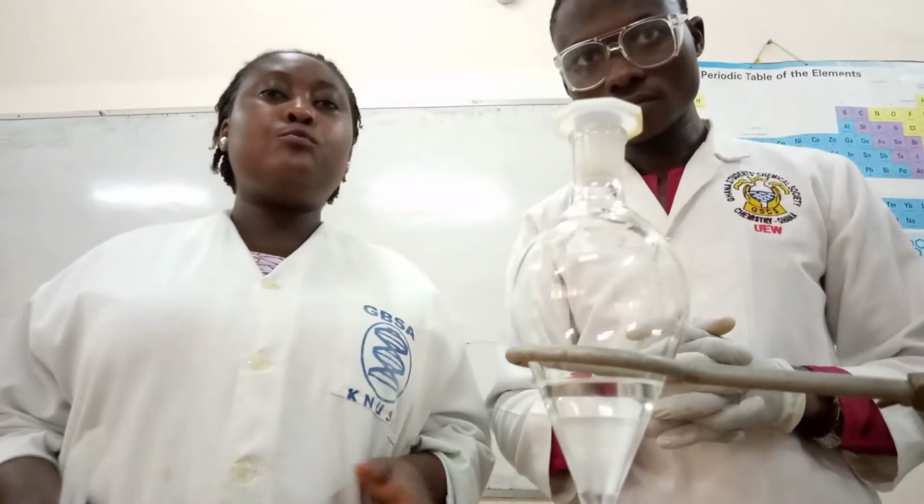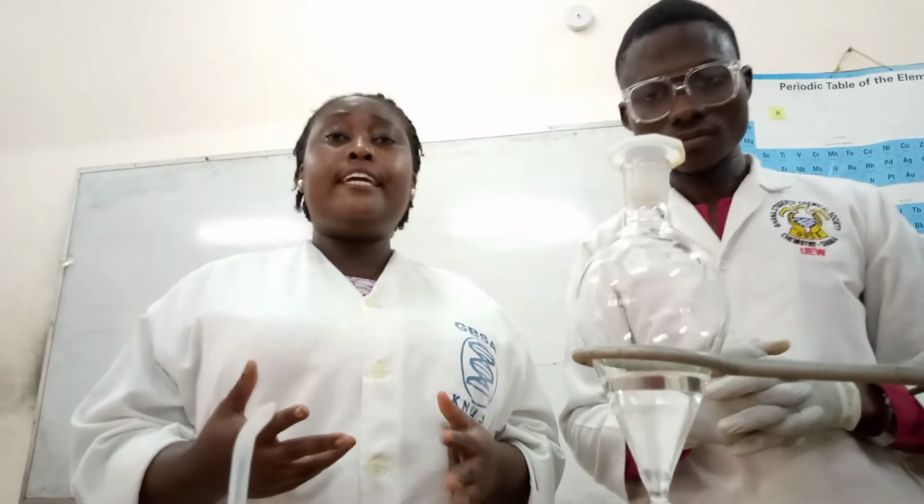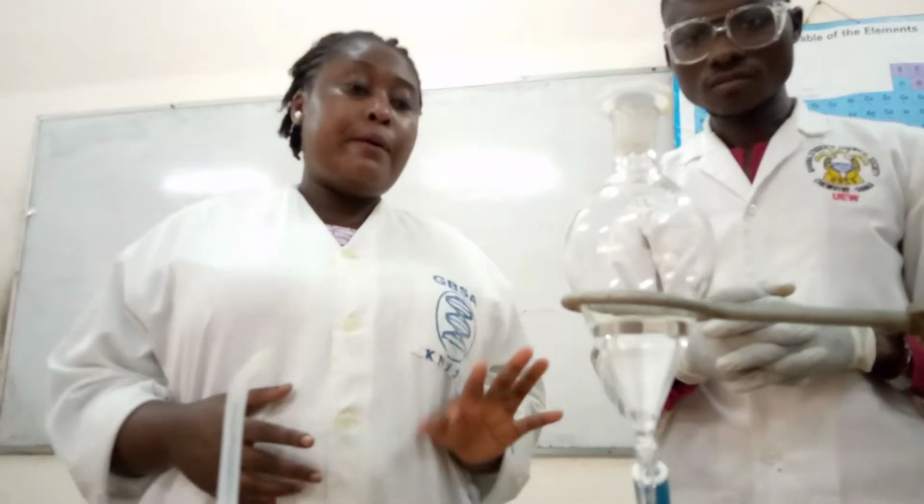So we are going to do 2 extractions. So after draining the aqueous layer, we will repeat the procedure again twice. You can do it more than 2 times. You can do it about 3 times or 4 times. And we are doing just 2. Okay.